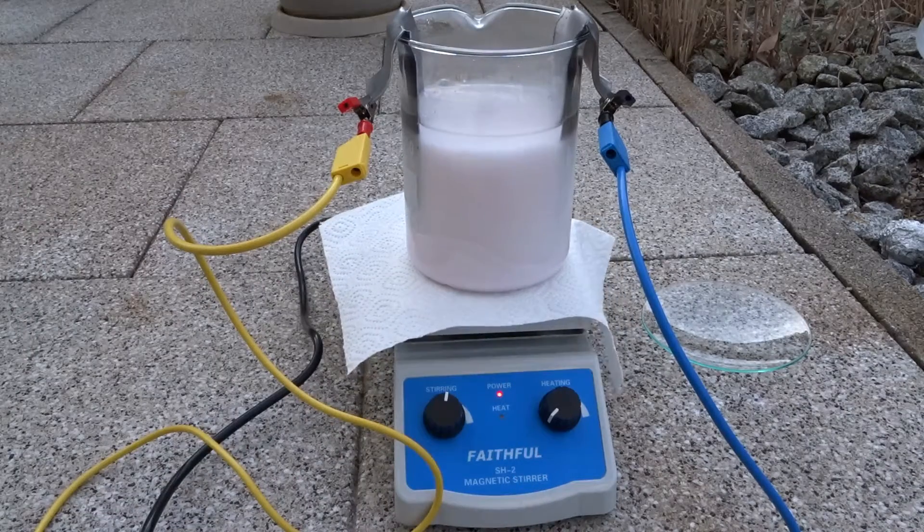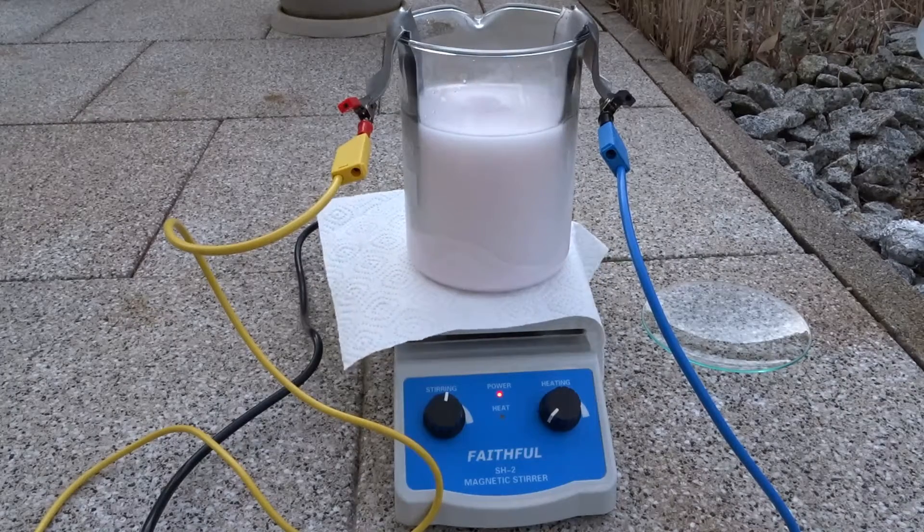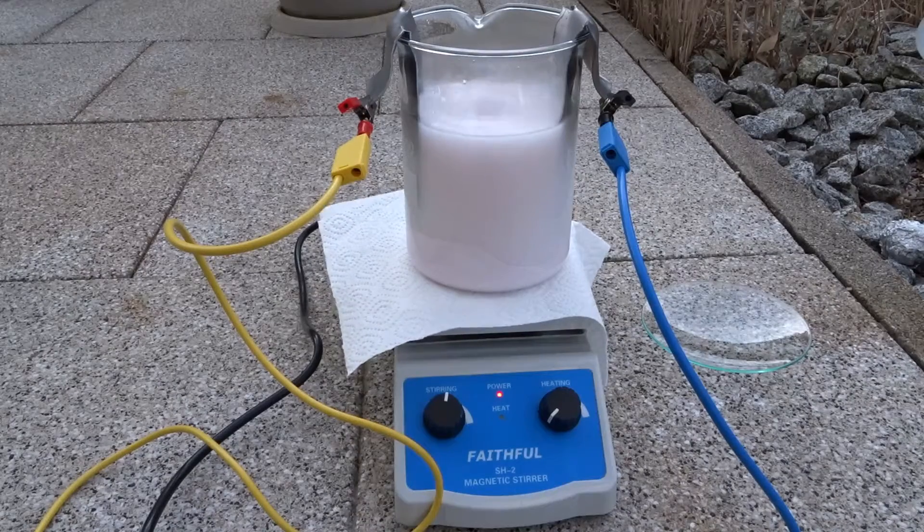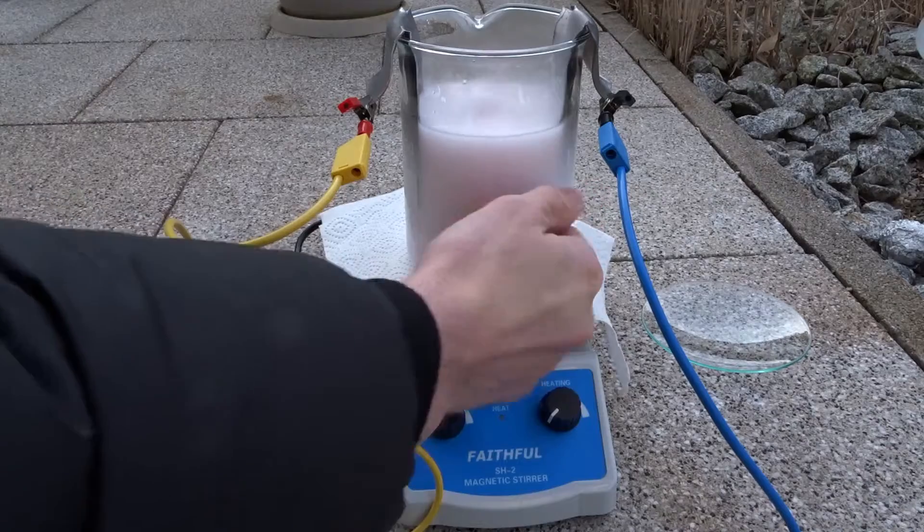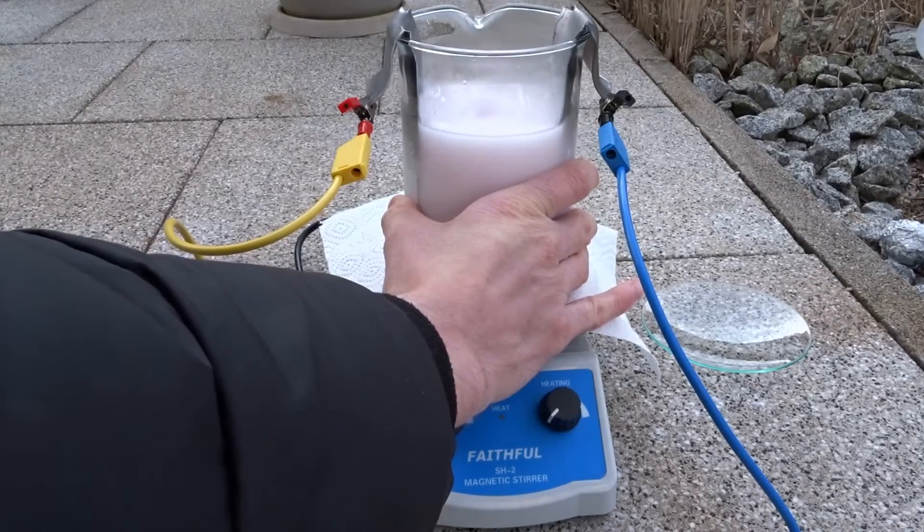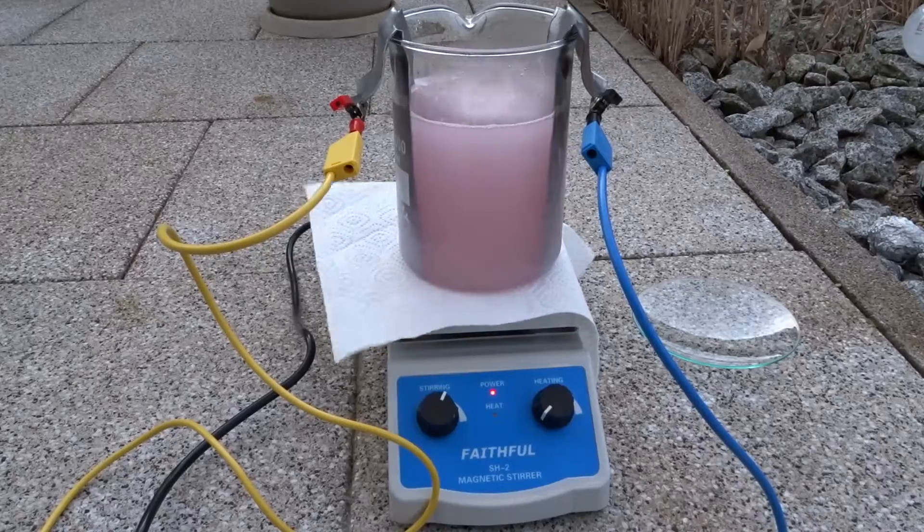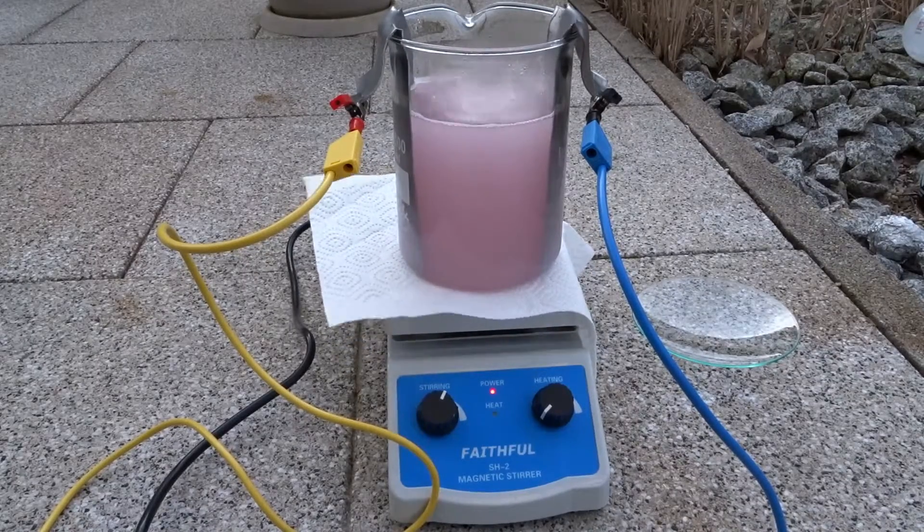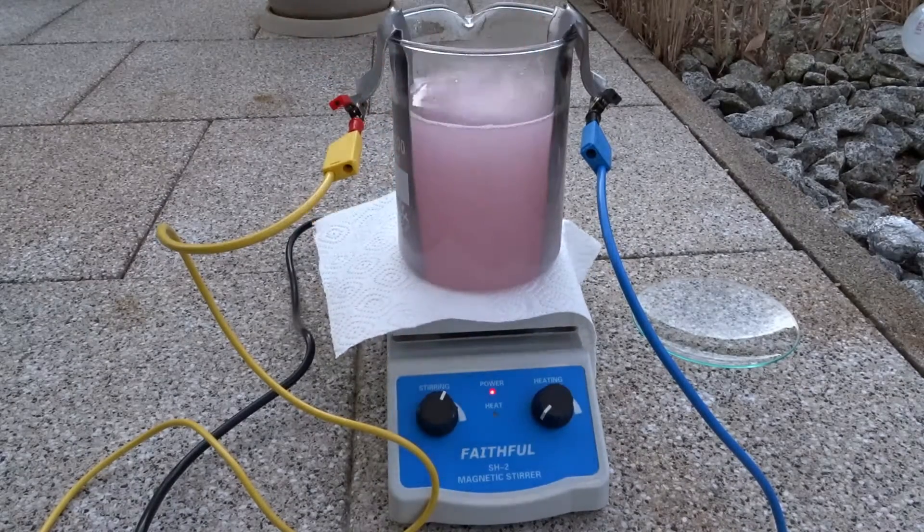Stirring is turned on in the hope to get this into solution. Finally, heat and strong stirring have made this work to get everything nicely into solution.